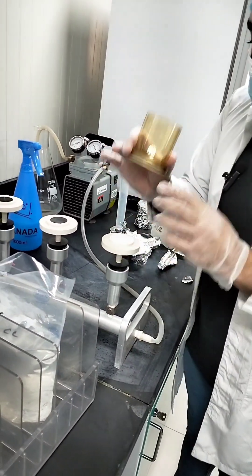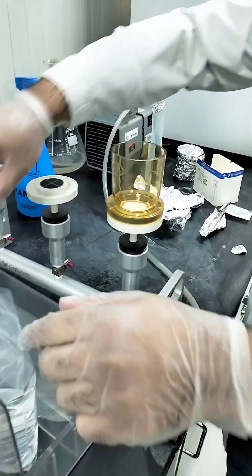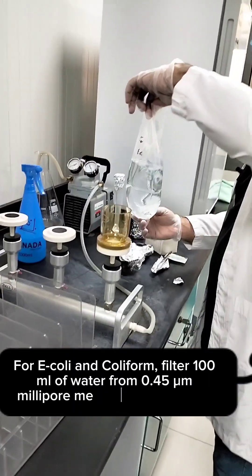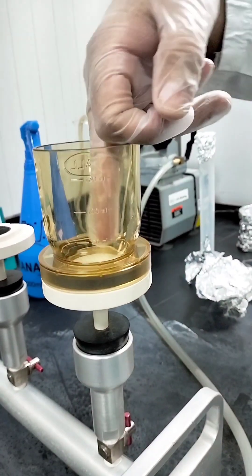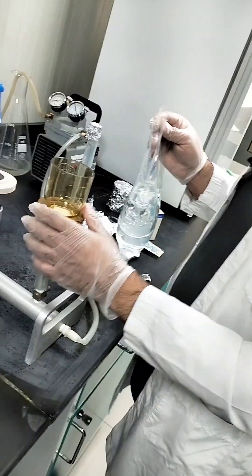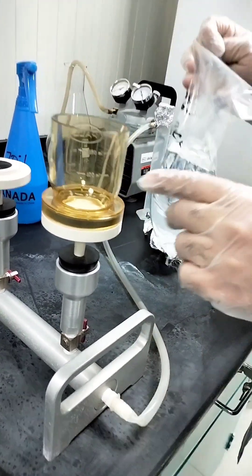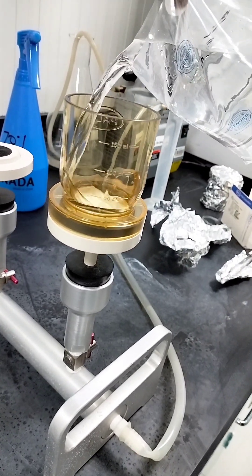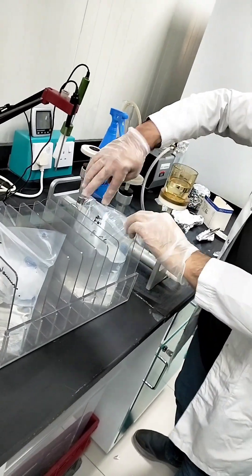Carefully adjust the glass funnel on the filtration assembly. For E. coli and coliform, I need to filter 100 ml of water. You can directly pour the water into the glass funnel, or you can use an autoclaved measuring cylinder to measure 100 ml. I will directly pour the water into the graduated glass funnel until I reach 100 ml. Now I will start my filtration pump. As you can see, the water is getting filtered. Wait until the water is completely filtered.